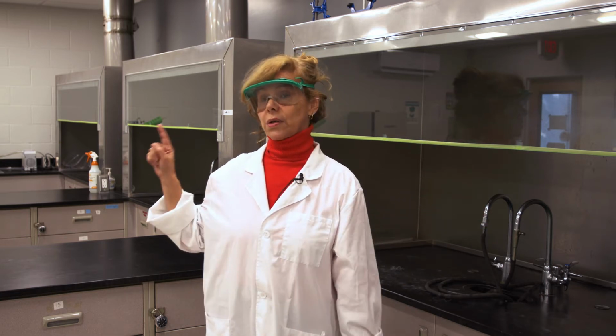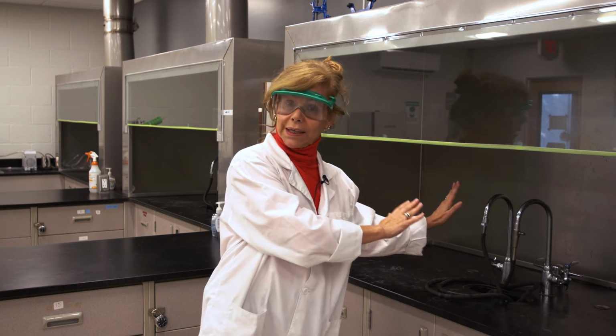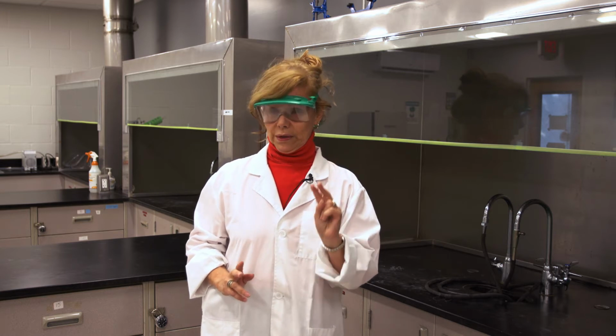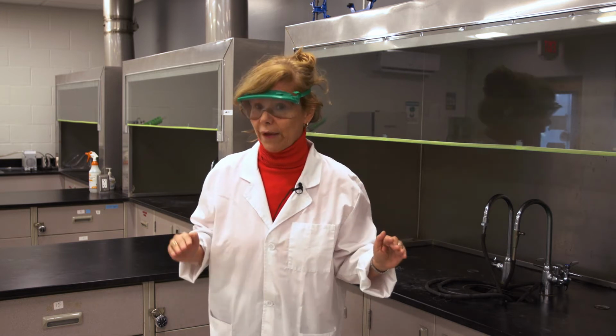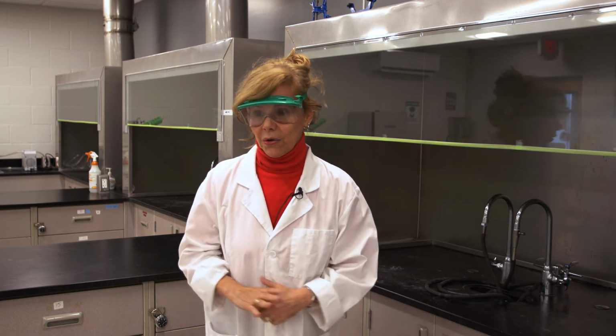And we need to turn on the hoods. When we come into the lab, there is a button that I need to push, and it needs to be on. So you need to be working in this hood at all times. The hoods can only have 2 students doing an experiment, so there is a cap for safety reasons. This lab has 6 hoods, so we can only have 12 students working at a given time.